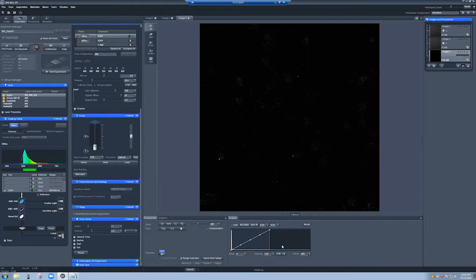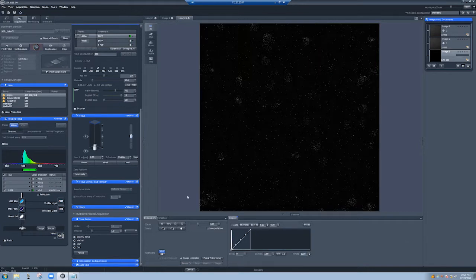I'm just lowering the white value just so I can see something. Let me see if I can move in Z to find something a little brighter. Okay, so this is probably some piece of garbage, but for the sake of just showing whether there's a lot of bleaching, it'll work just fine.